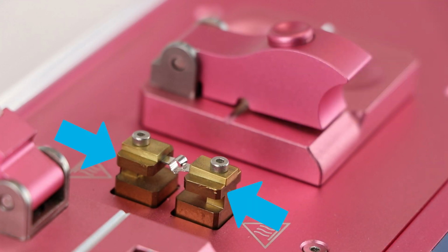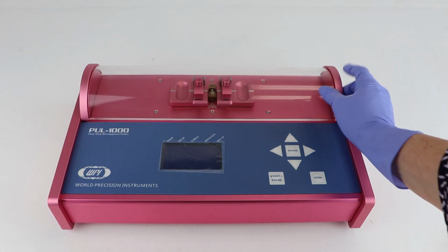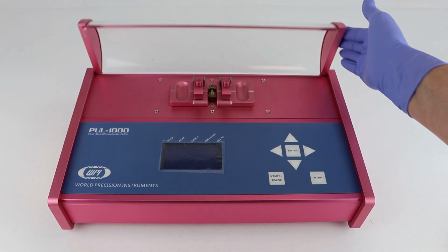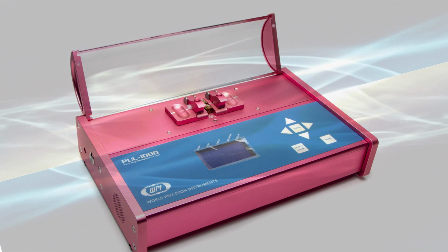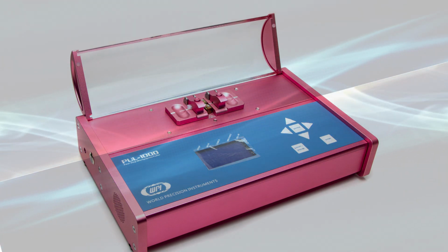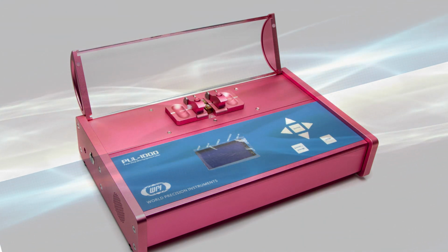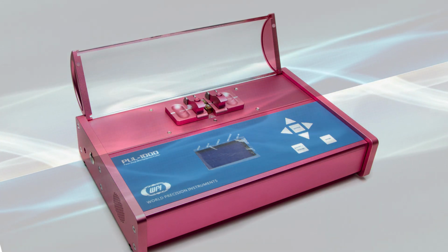First, the filament holders heat up when current passes through that filament, which can get even hotter as the puller is used continuously. To reduce the heat residue buildup, allow time for the colder ambient air to cool down all the components between pulls. Second, the convection of air in the ambient environment, both inside and outside of the covered chamber, affects the heat transfer from the filament to the glass. So room temperature and humidity affect the glass's transition.